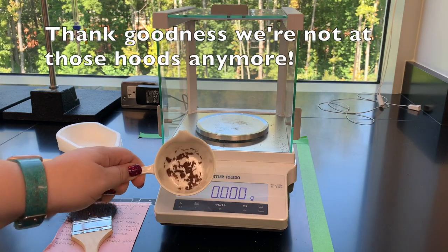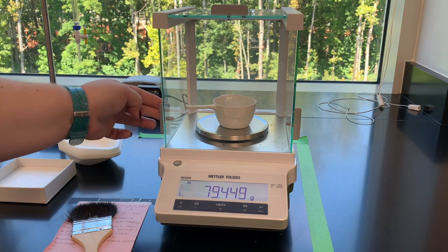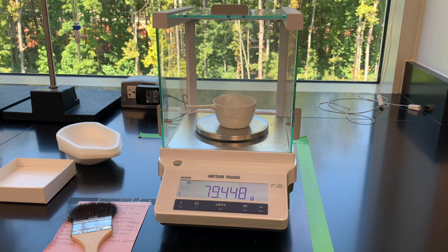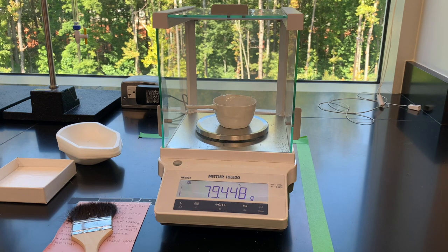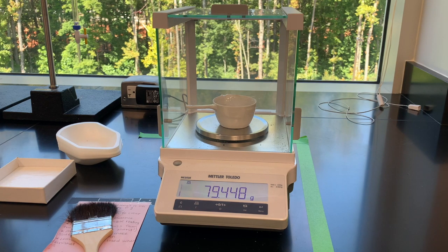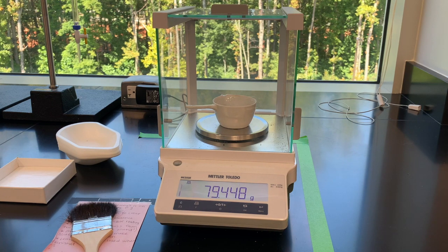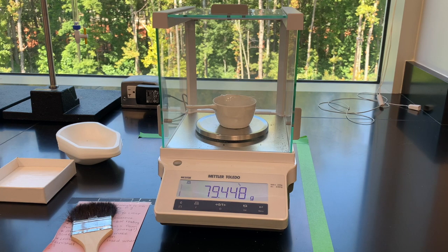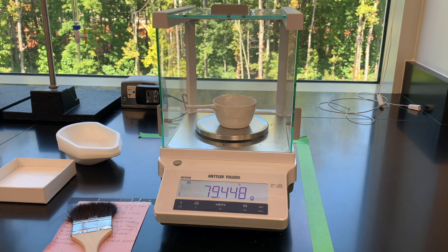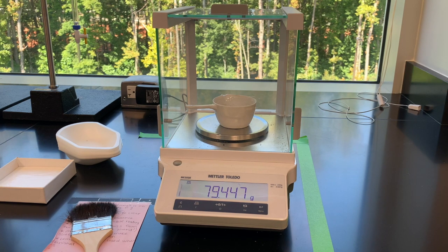Our copper has now dried and cooled off in the evaporating dish, so we can take the mass of the evaporating dish plus the copper. My balance is zeroed out. The mass of our copper plus the evaporating dish is 79.448 grams — this should go on your report sheet. Now you can calculate the mass of your recovered copper and the percent yield of our reactions today. Your theoretical yield is going to be the same amount we started with: 0.550 grams of copper. We started with copper, took it through several reactions, and ended up with copper — your actual yield is the amount of recovered copper.